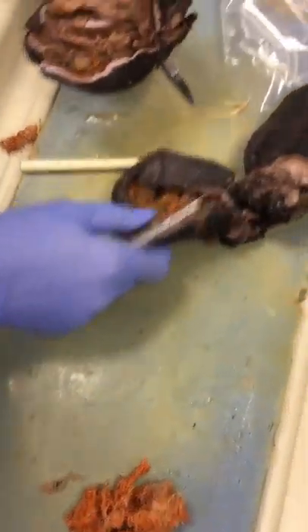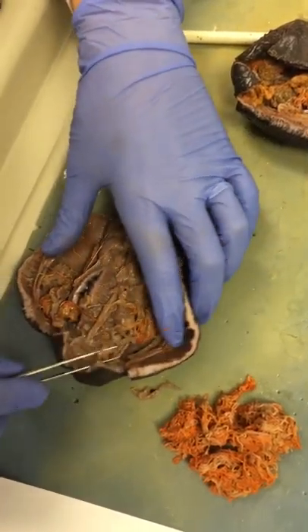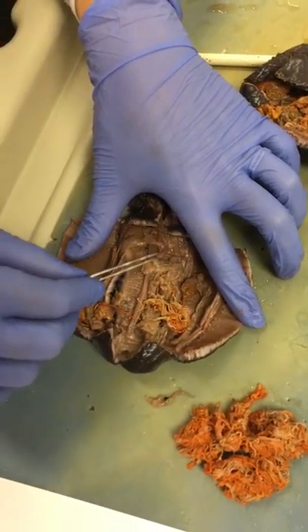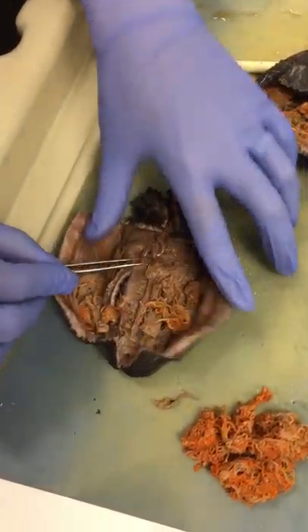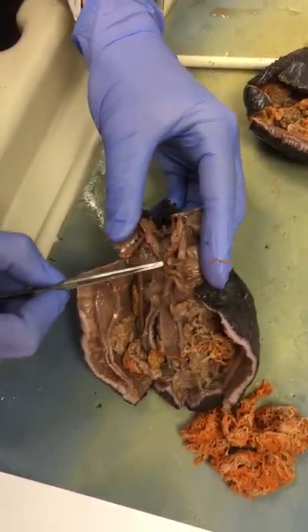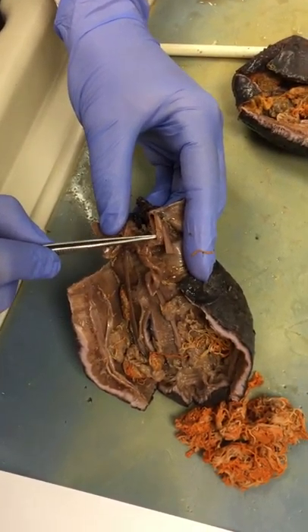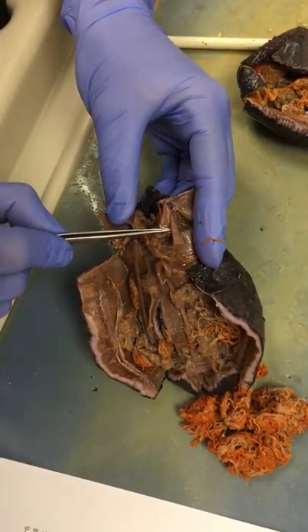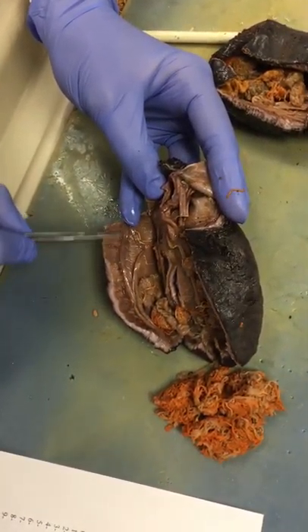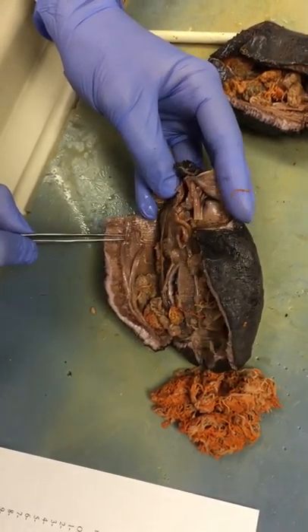Let's go ahead and look at this organism over here to get a different look at all this stuff again. This is the respiratory tree right here; this is again the gonads. You have the intestines coming off the stomach region. In this one, you can actually see part of the ring canal. The ring canal is going to lead to the radial canal, and the radial canal is associated with the longitudinal muscle — that's what feeds the ampullae so that the tube feet can aid in locomotion.